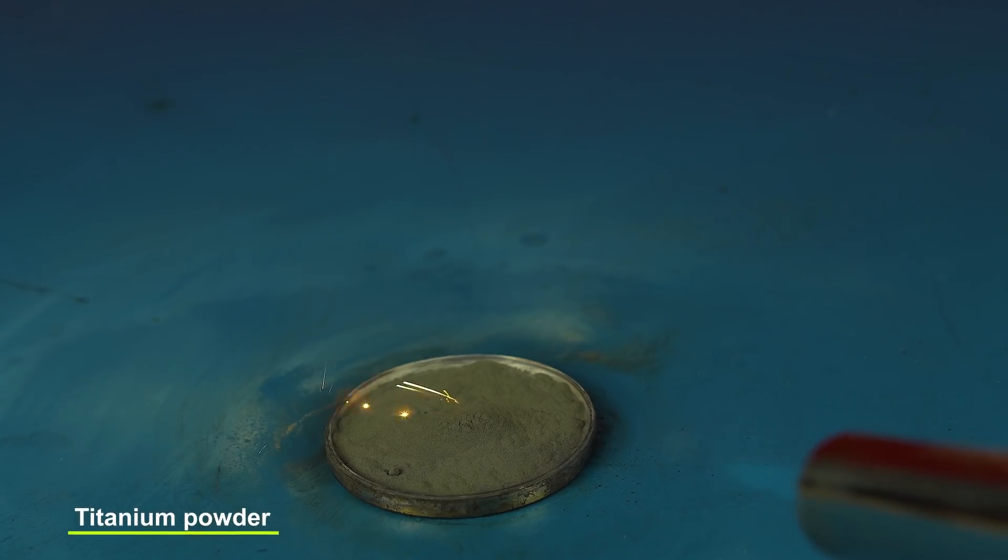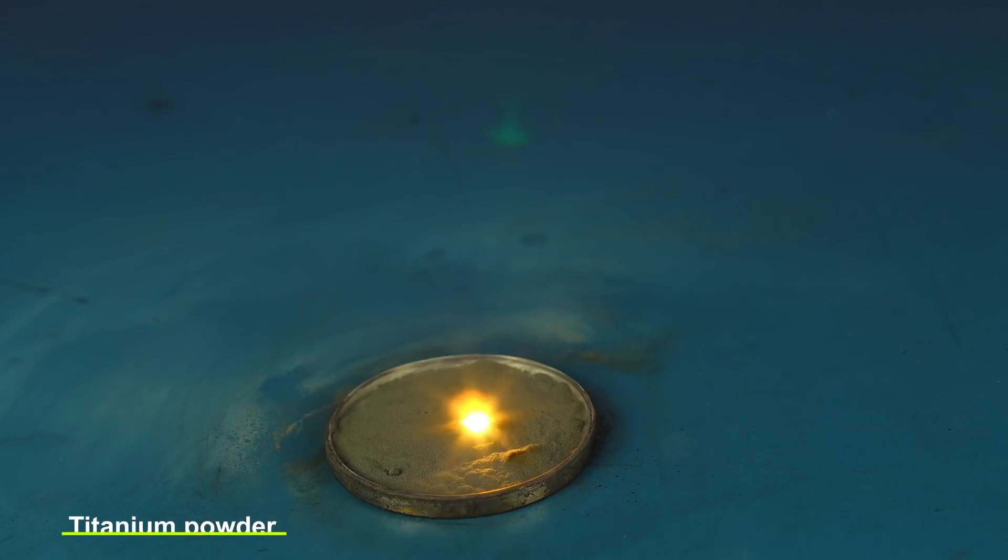In a science article, I read that titanium reaction is also violent, so I did it too.